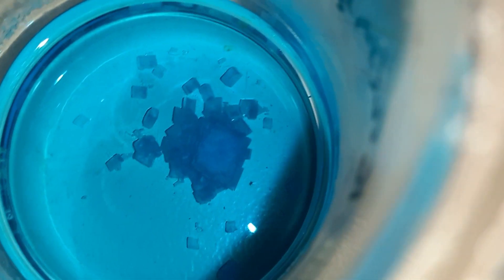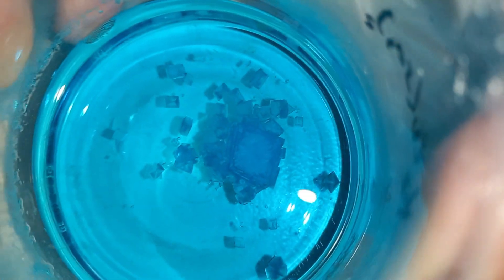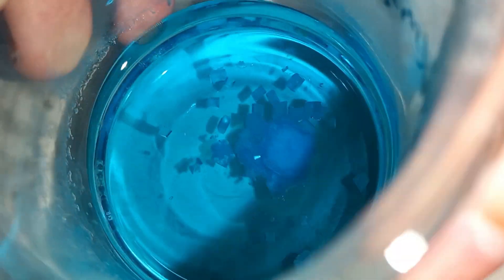It's pretty cool. Look at those beautiful structures — a synthesized naturally occurring mineral. Ain't that cool.